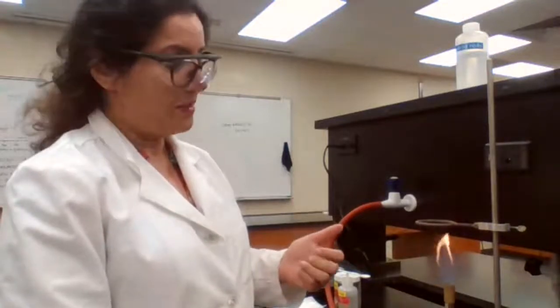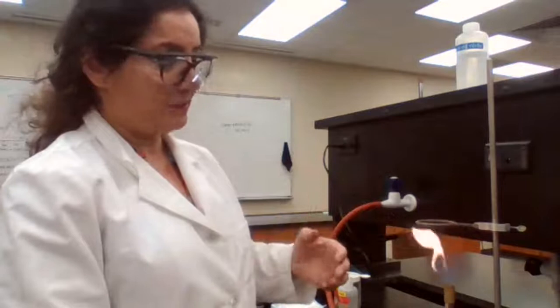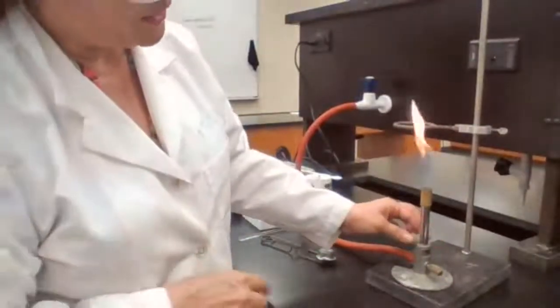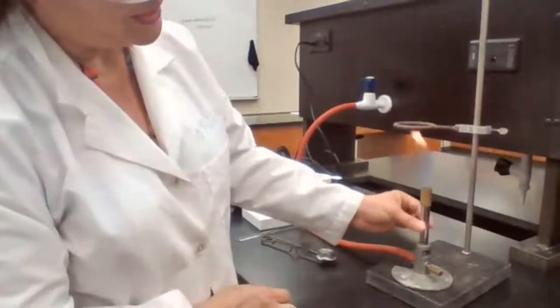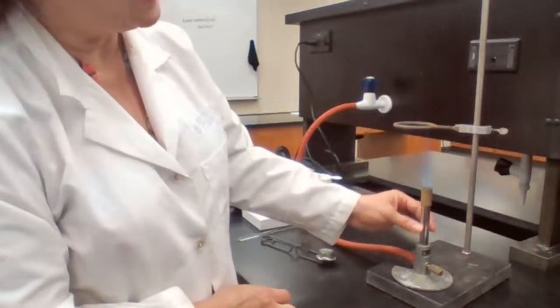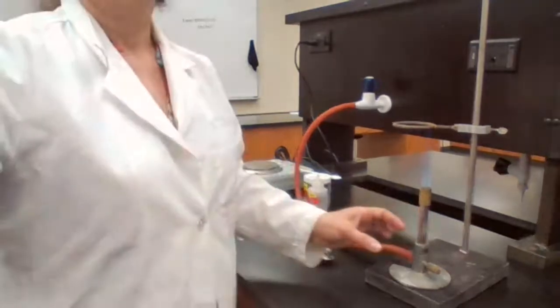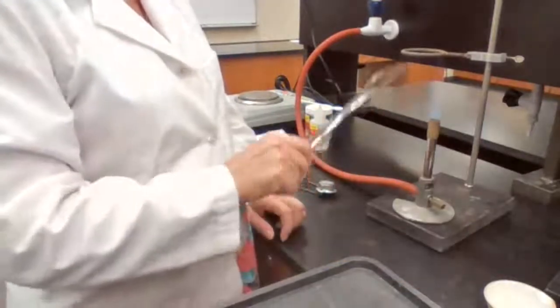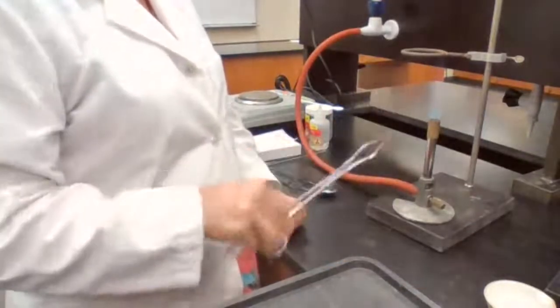Two problems: carbon monoxide is toxic. We don't want to have it in the lab and inhale it. Second problem is that the flame is not hot enough. So how to take care of that problem? You have to provide more oxygen. To provide more oxygen, you are going to rotate the cylinder to the left side until you get enough air. You see the 2 cones here on the flame. You have the darker and lighter blue color of the cones. Now you have a perfect flame.